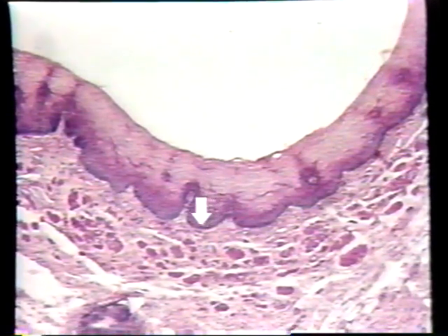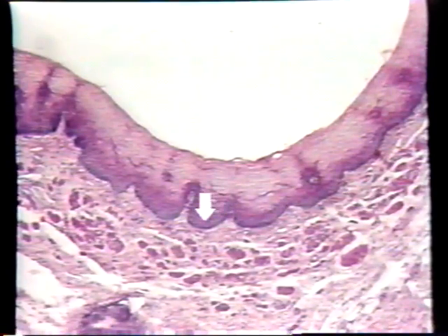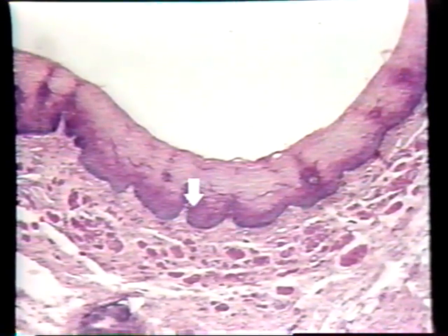The bottom layer of cells here looks purple, and that's because the nuclei are all lined up and the nuclei are purple. The bottom layer of cells undergo repeated mitotic divisions and give rise to other cells that migrate through the epithelium and become flatter and flatter as they reach the surface. Eventually they're shed into the surface here as they're worn out, and they're replaced by the mitotic activity of the basal layer of cells, which is located down here.